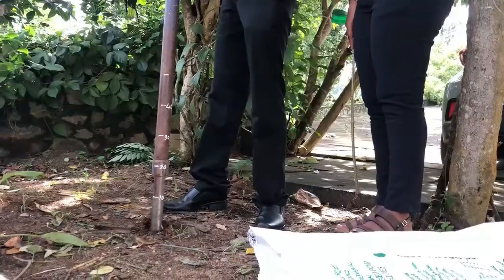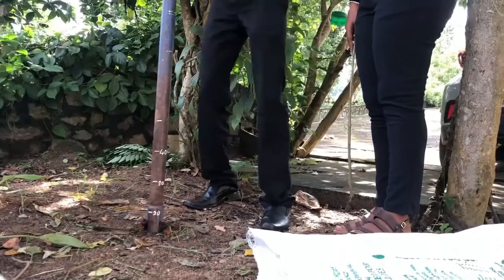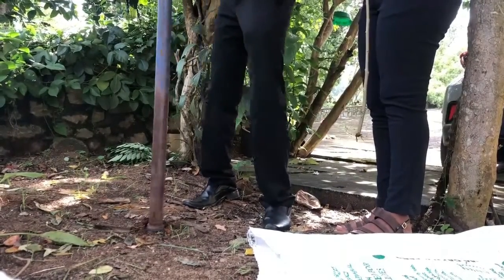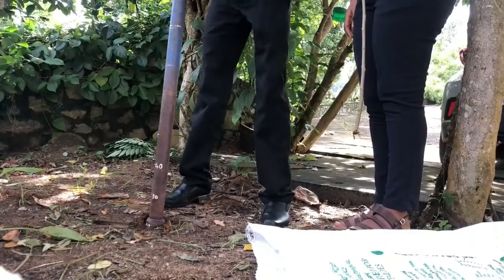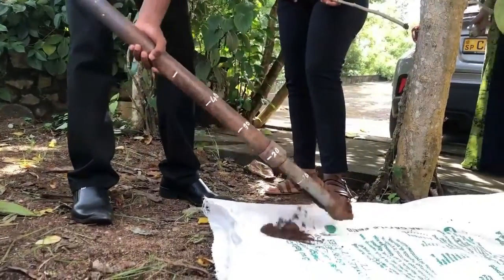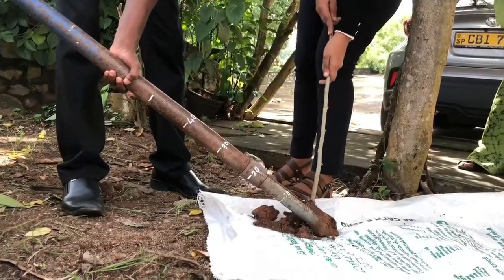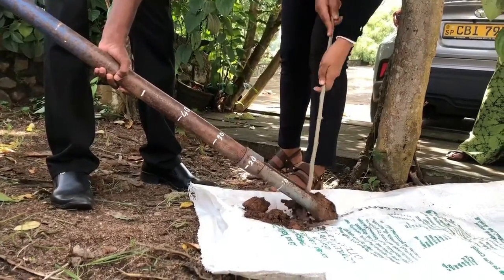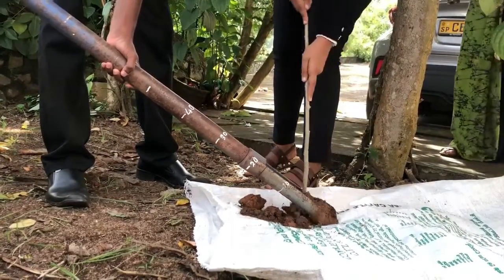Let's take another soil sample from 10 to 20 cm depth as we practiced earlier. As demonstrated, collect samples from all four different depths. Finally, the collected samples will be packed in an airtight polythene bag and taken to the laboratory for further procedures.